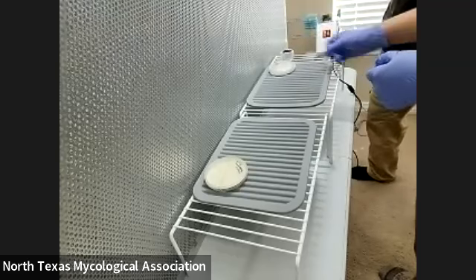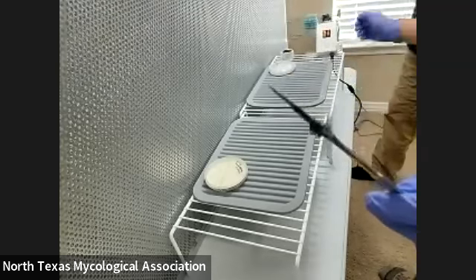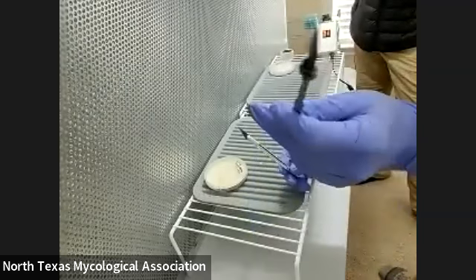What do you extract them with? With a scalpel. So I have a scalpel here. You can also use this little hobby knife you can get at Walmart or whatever. But I have an actual scalpel you can order online — should be like $2 or something like that.